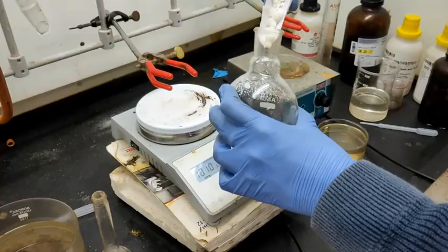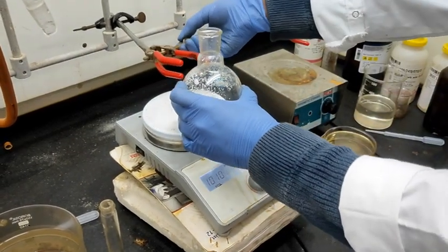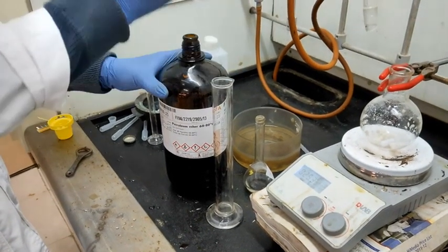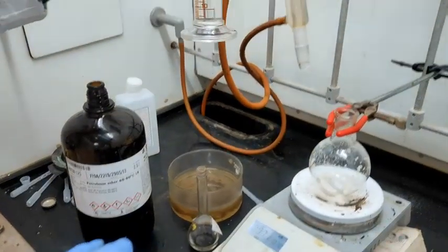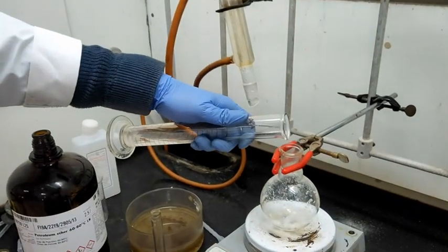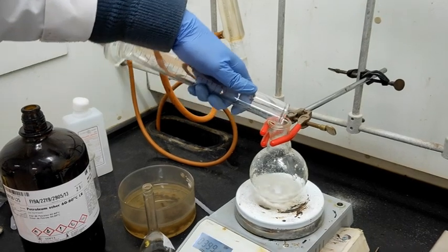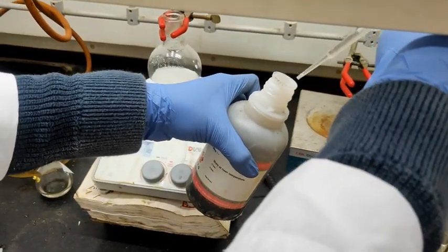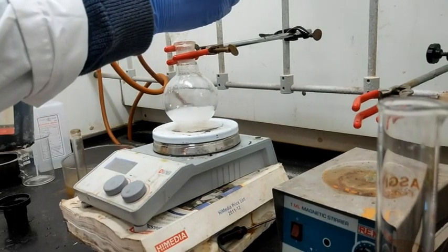Part 2: benzanilide preparation. Add a sufficient amount of ether to the round-bottom flask containing the benzophenone oxime produced in the previous part. To the above solution, add concentrated sulfuric acid, about 4 ml, while stirring continuously for 15 to 20 minutes.